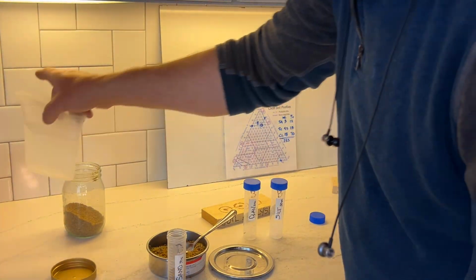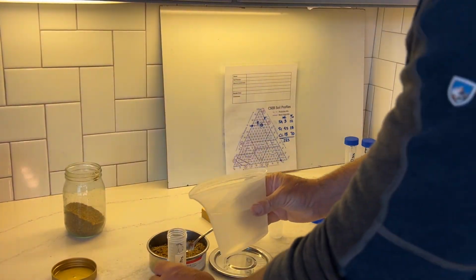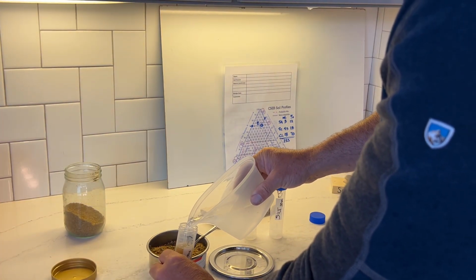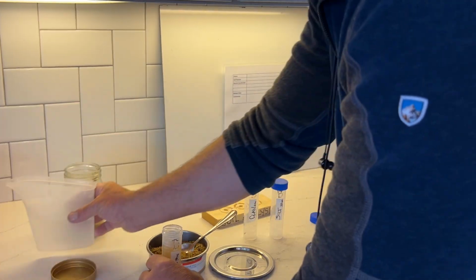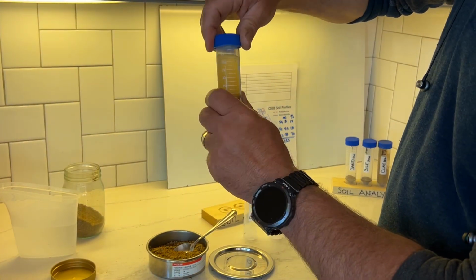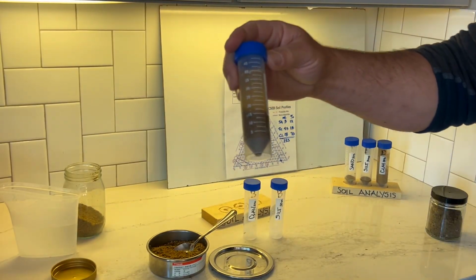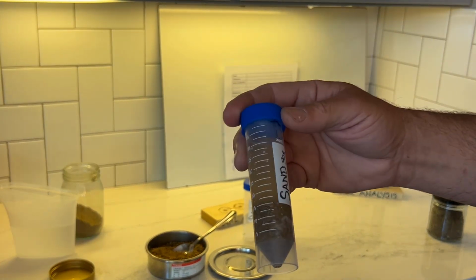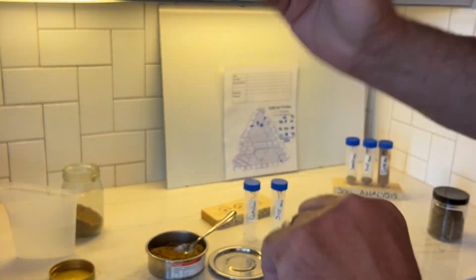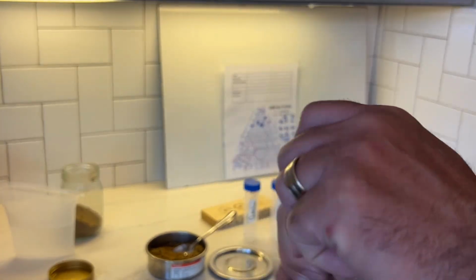So next we're going to take some water, and then we're going to have a timer. I like to fill this up to about 40 milliliters. You want to leave yourself some room to shake. If you've got air in there, it helps it shake. But what we're going to do is mix this up for a minute. So you kind of need to watch your watch. So we're at the 40-second mark. We're going to mix this up really good for a minute.